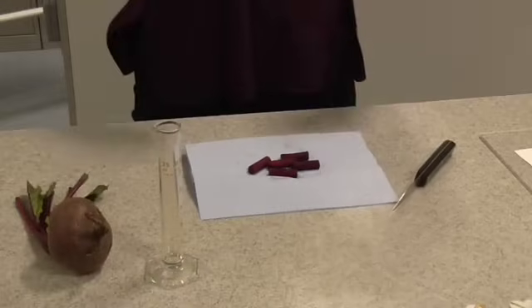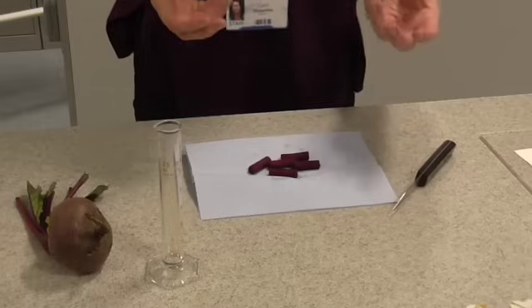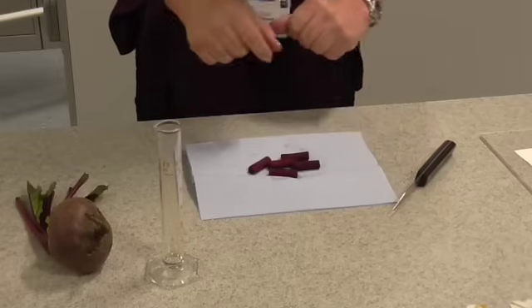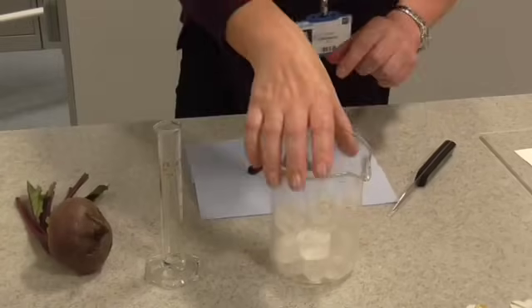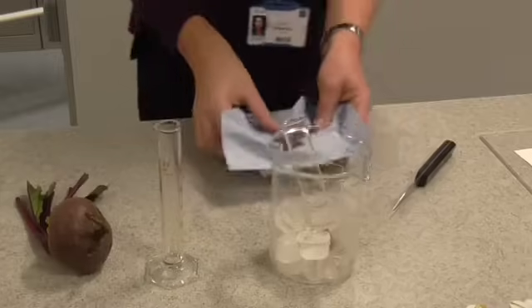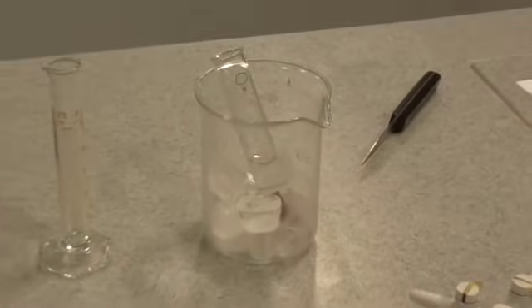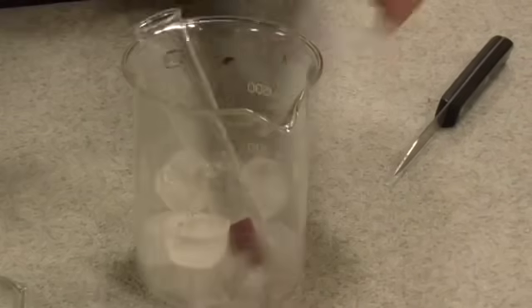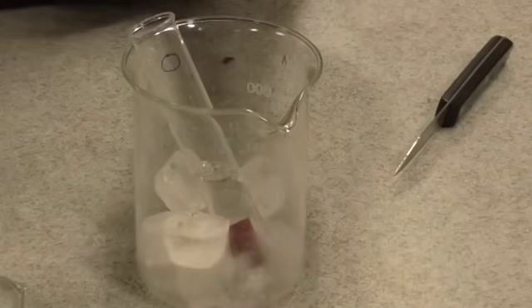After a period of time, when your various water samples have come to the right temperatures and have equilibrated, you need to go around your water baths and place one little chip of beetroot into each of them. You're then going to leave that in the water bath for 20 minutes.